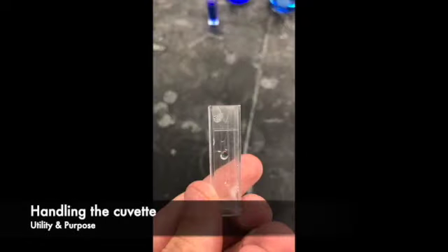First off, we will talk about the cuvette. This holds our stock solution and its dilutions that will be used in the spectrophotometer. The line right under the arrow is the line that we will be filling up the solutions to.